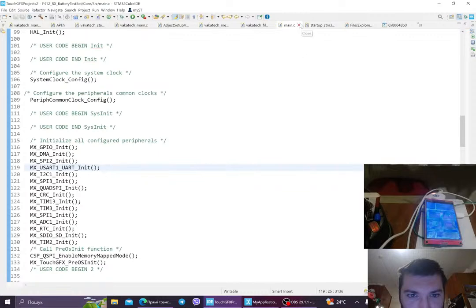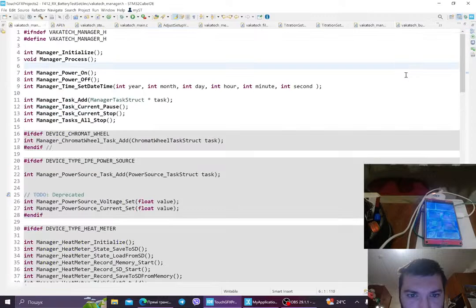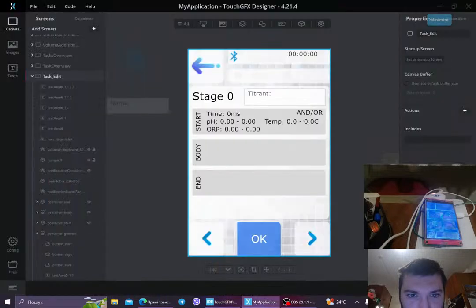So I'm using TouchGFX mainly because, well, this is the official one. This is the official framework, the UI framework for STM32, and it's actually quite nice and robust. And again, I've gotten used to it actually. So yeah, and it gives you a lot of variability.